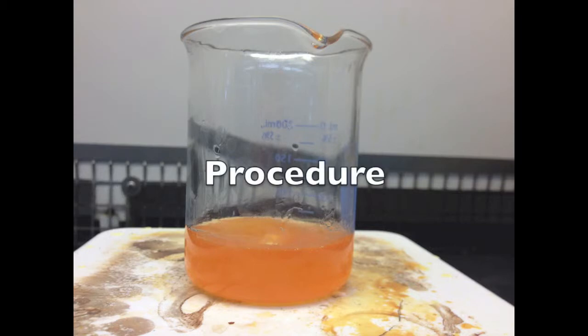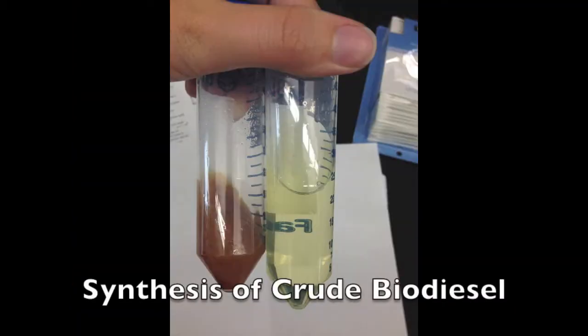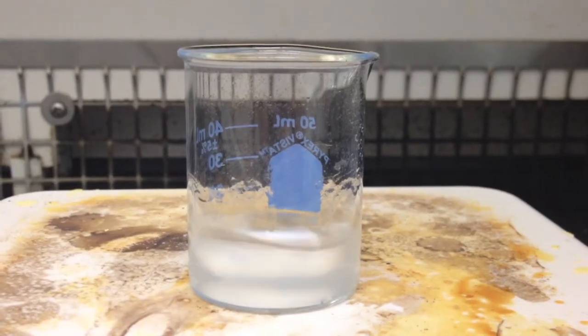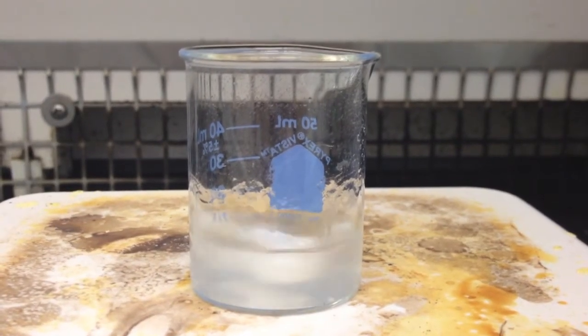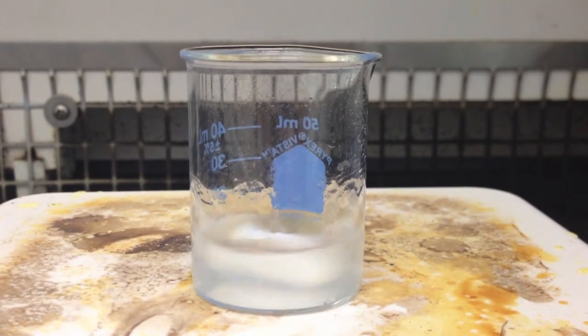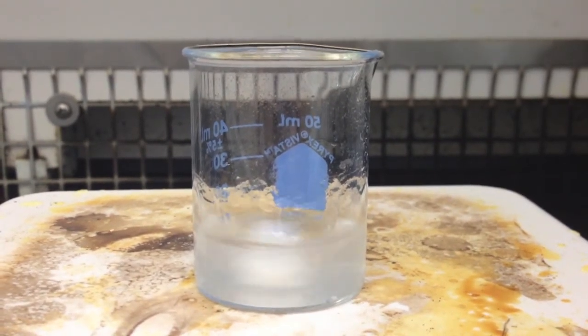Now let's review the procedure. First, you will use seed oils to synthesize crude biodiesel. Start by adding 14 ml of methanol to a 50 ml beaker with a stir bar. Place the flask on a stir plate. Set the stir speed so that it stirs vigorously but doesn't splash. Slowly add 0.5 grams of sodium hydroxide to the mixture and wait for it to completely dissolve.